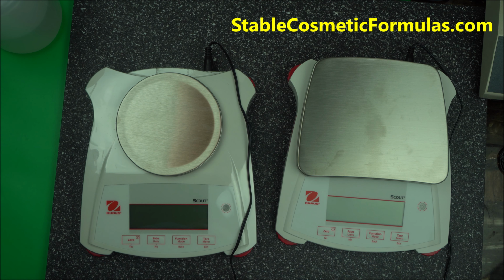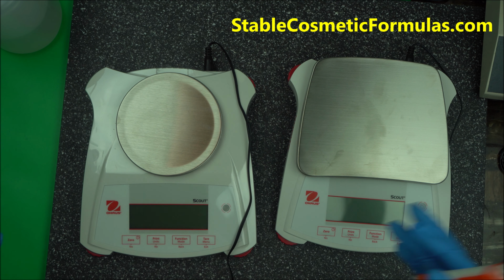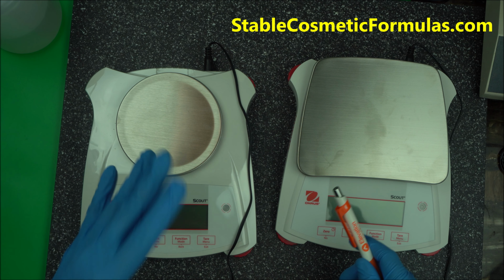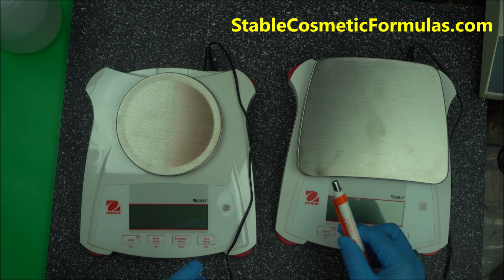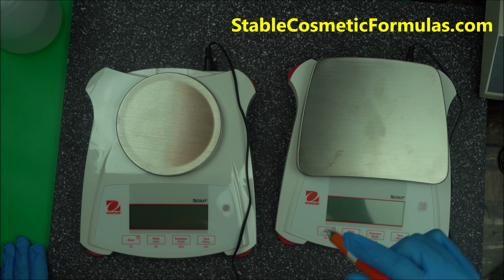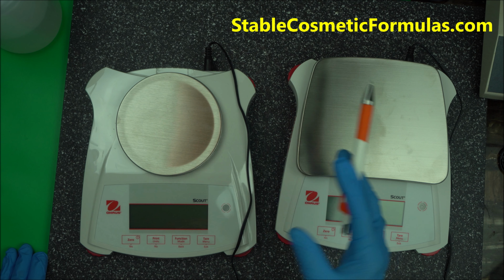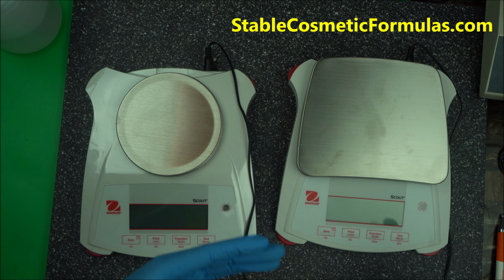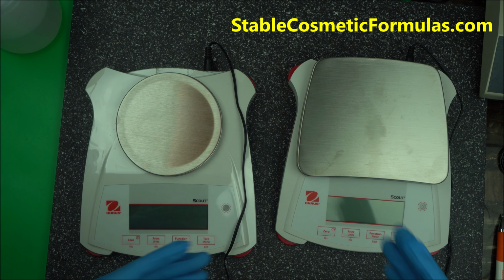So as a cosmetic formulator, please do not get a regular scale. Go for an electronic balance scale. They usually call them electronic, sometimes precision scale, electronic balance scale, and so on. Just make sure you go for an electronic balance scale. They are very good for you, fast and accurate. A lot of emulsions are failing because you are taking wrong measurements, you are using the wrong scale. So if you used to use some scale that perhaps I recommended for you in the past, you may want to upgrade now when you are making beauty products to sell.